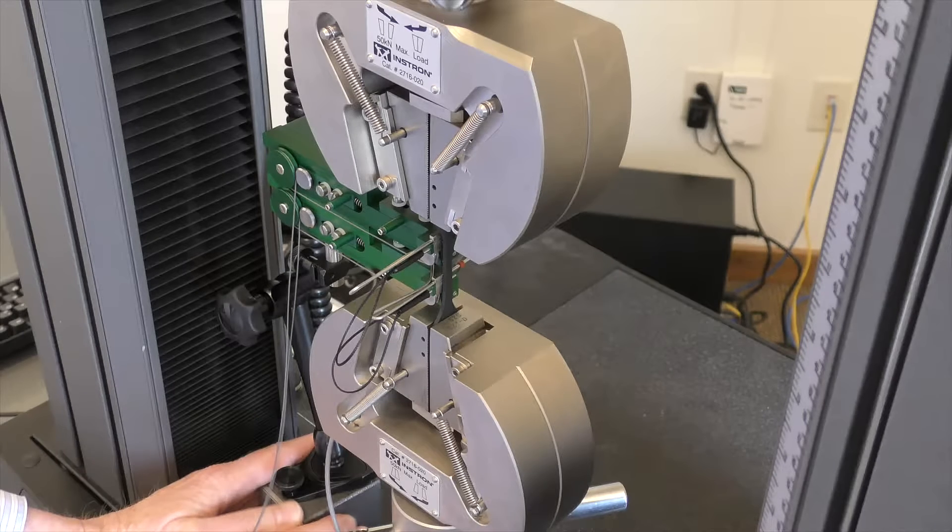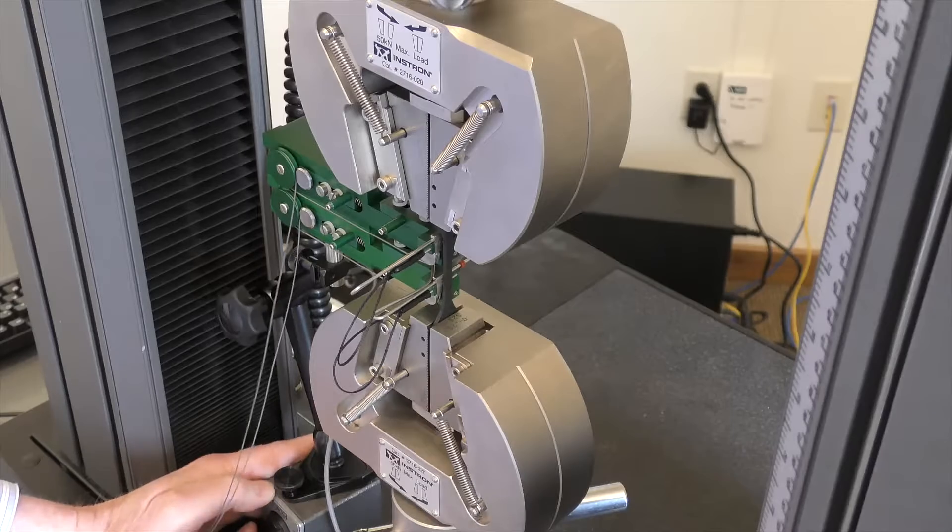This is easiest to accomplish with the spring clips rotated up and out of the way. Lock the magnetic base.